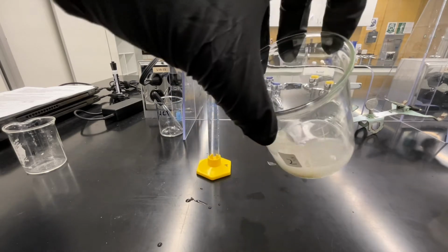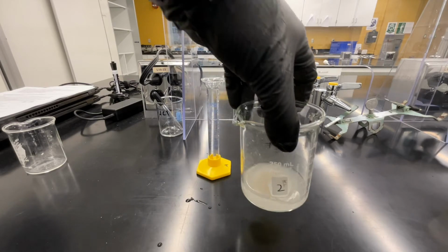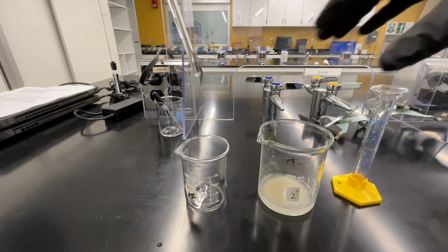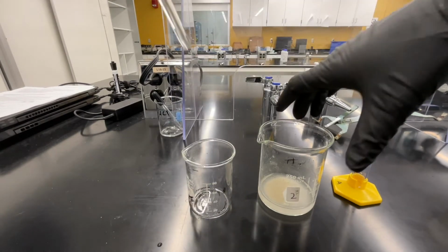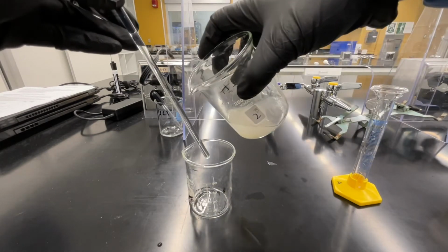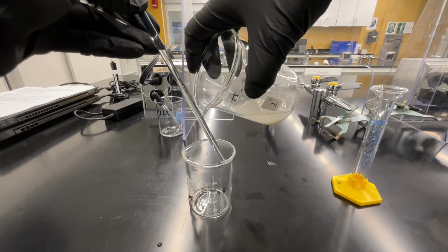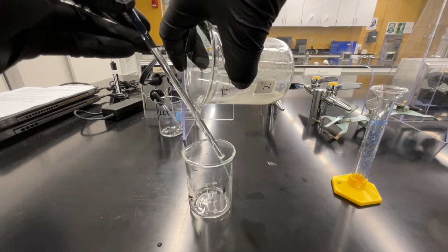Once you're satisfied that the reaction has completed, set the beaker on the countertop and allow any of the solid particles to settle. Once your solution has settled for a few minutes, we're going to decant the liquid away from the residual solid left behind. Here, again, think about what it is that we're decanting and what solid is left behind. We're going to decant into beaker number 1.